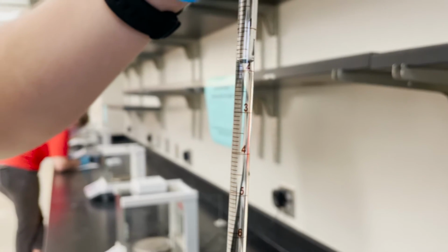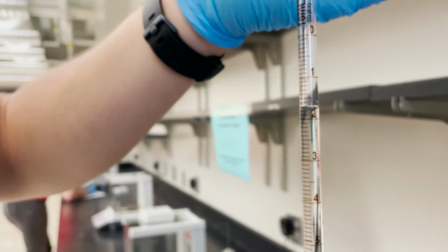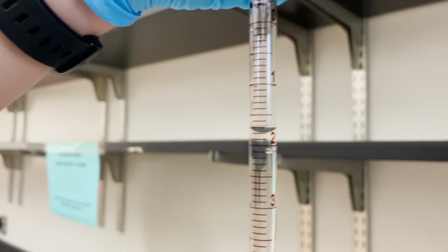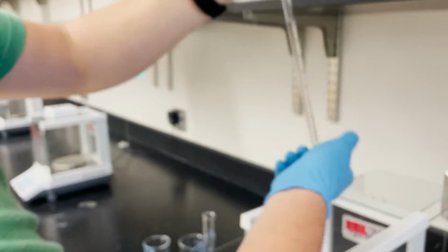Later on in this presentation, we will be using stock solutions and varying their dilutions. A stock solution is defined as a concentrated solution that will be diluted to some lower concentration for use. To dilute something means to make a liquid thinner or weaker by adding water or another solvent to it.